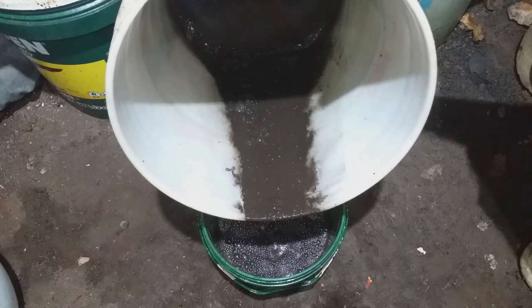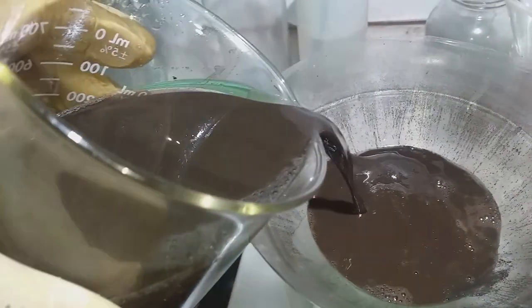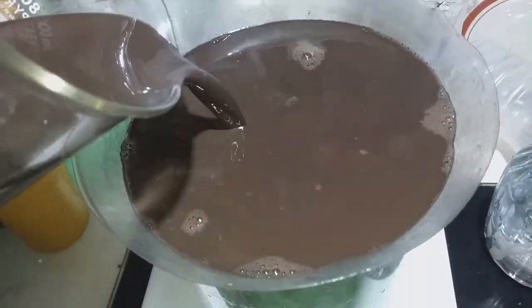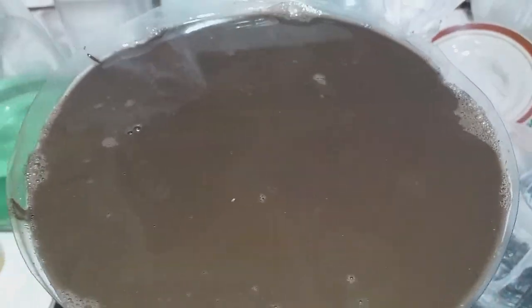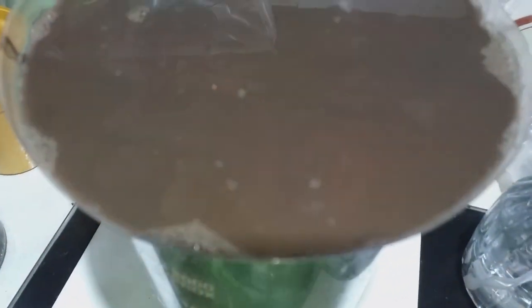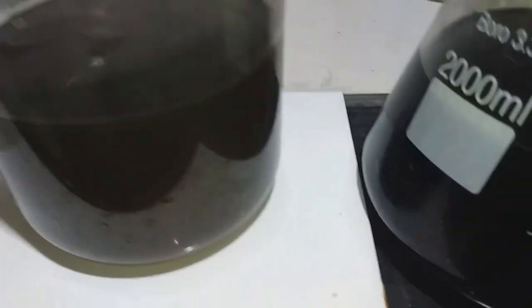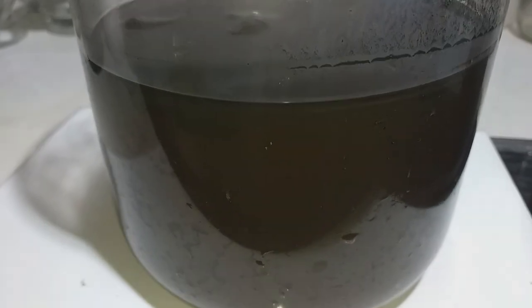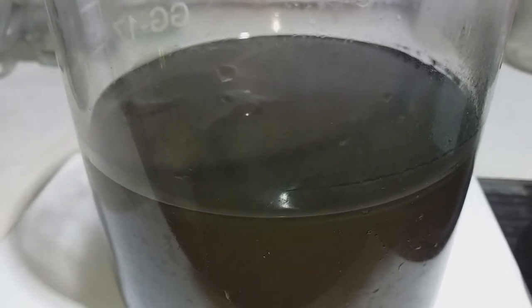Lots of precipitation — let's start filtering. So what I have prepared here is a copper chloride solution. We pour it onto our precipitation to dissolve some copper and other materials like steel or aluminum. Let's begin.